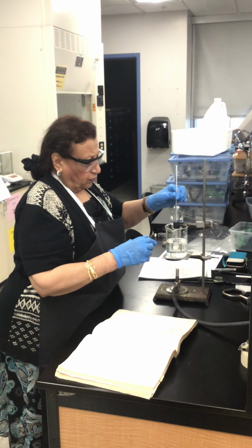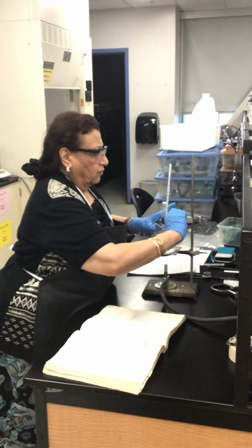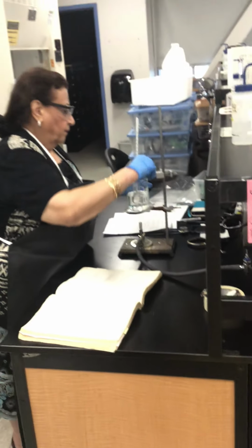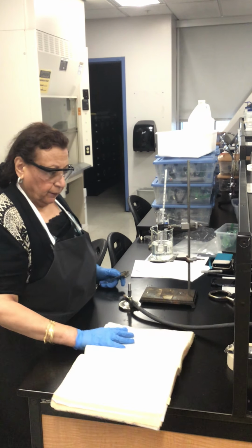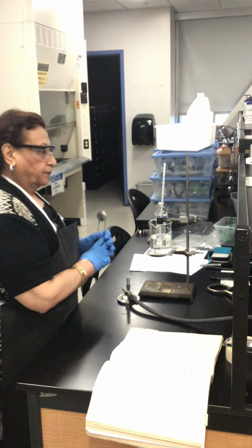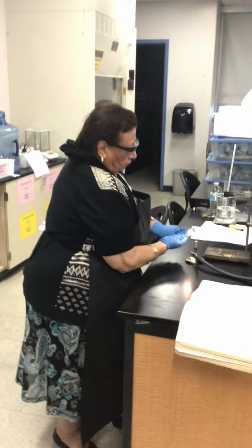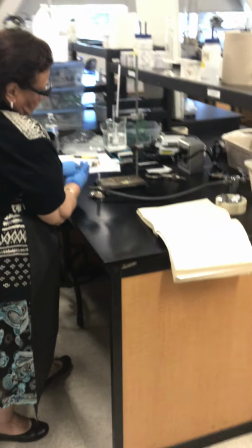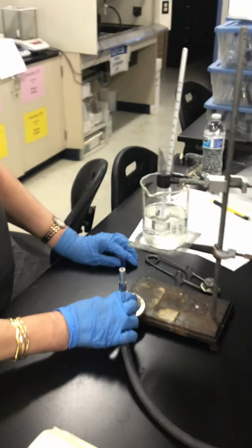All right, I'm going to turn the Bunsen burner on. Okay, we're going to heat.